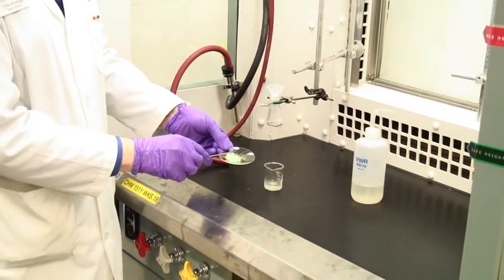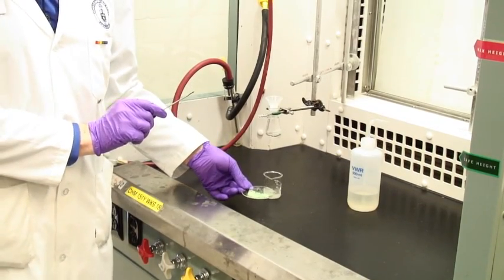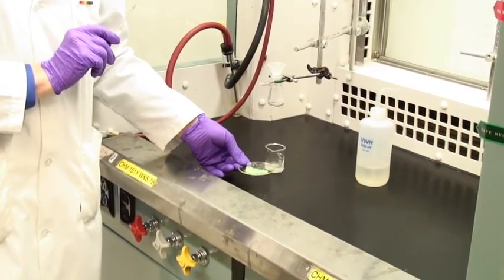You've got the solid, spread it out to let it dry even more, and there is your filtered product. And that is how to do suction filtration.